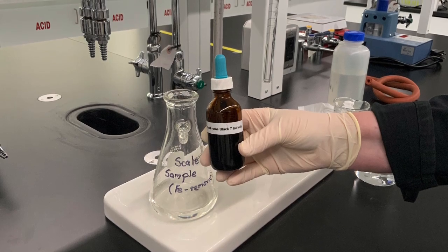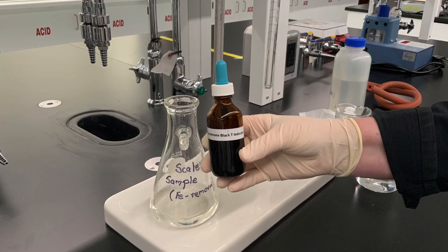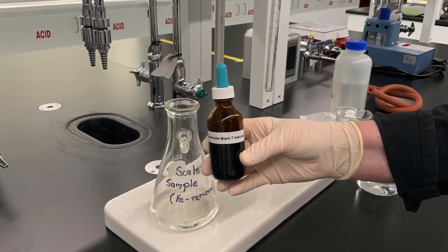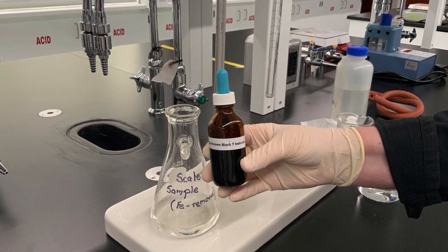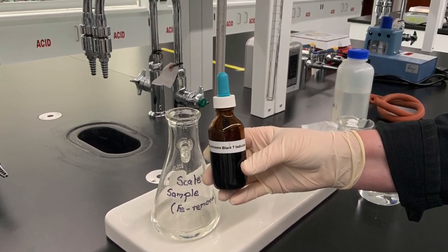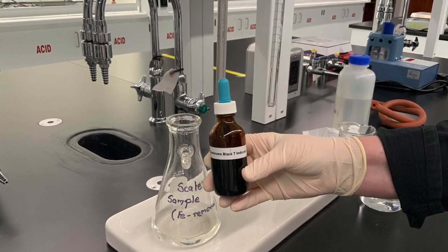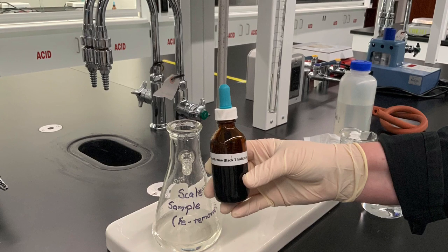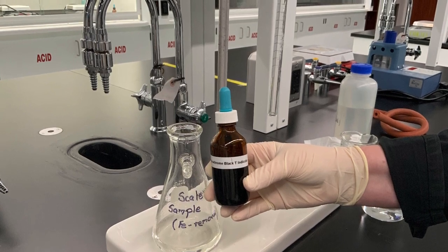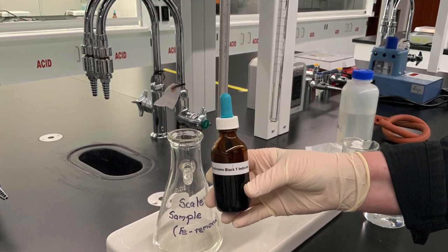A titration is a volumetric analysis. This analysis depends on our ability to observe the progress of a reaction. To observe this, we need an indicator that typically allows us to determine at what point we have combined equivalent amounts of the two reactants. Read the theory section of the lab manual to better understand the following procedure.